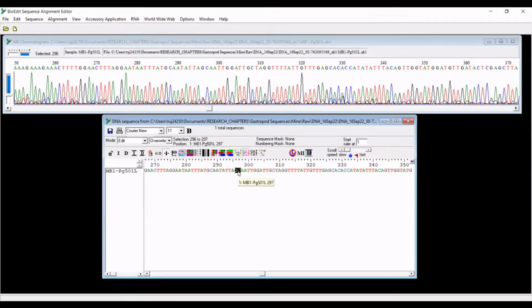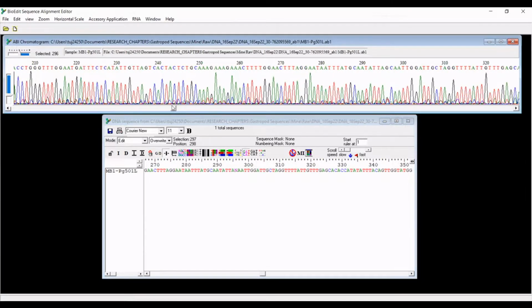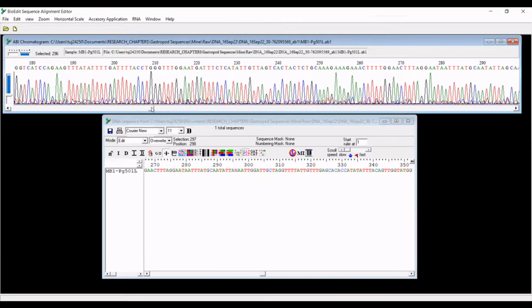I don't particularly agree. So I'm actually just going to select this base here. And I don't know if I particularly agree with this base call. Instead of changing this to a C or a T or something else, you can change it to an N. And so if you highlight a certain letter, you can type in a different base, so you can change any of these bases that you'd like. Of course, you don't want to manually do that too often because you don't want to manipulate your data any more than is absolutely necessary for a variety of reasons, particularly academic integrity.